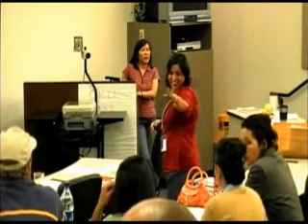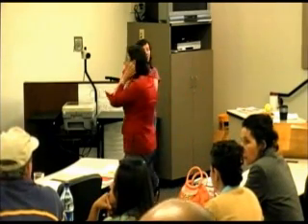Don't worry, we're okay. You can try other solutions. I tried a different spot here with the water that Saul just got, and it's a different color than number 7. So I'm wondering if maybe the tray was a little bit contaminated. Not the tray, the water source. We washed it. Trays were clean.